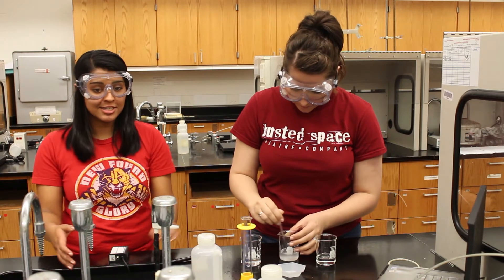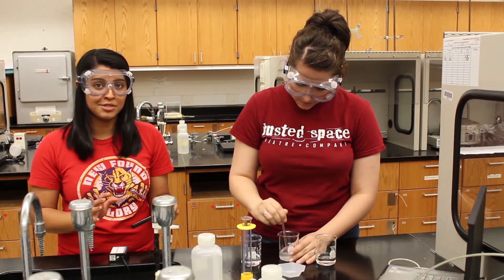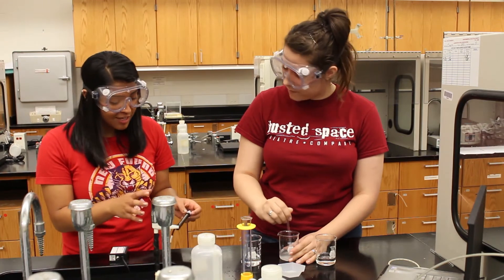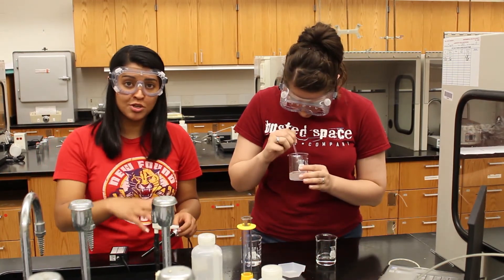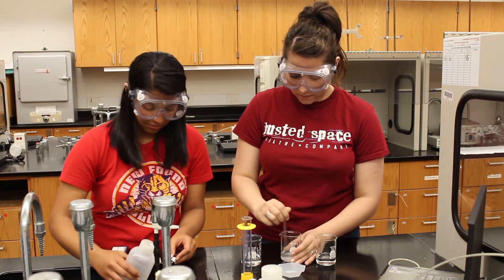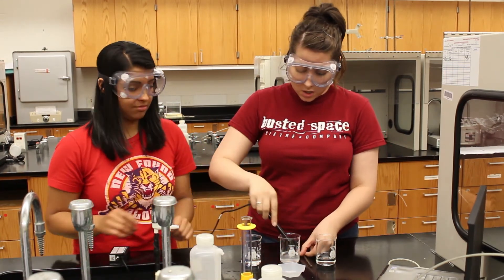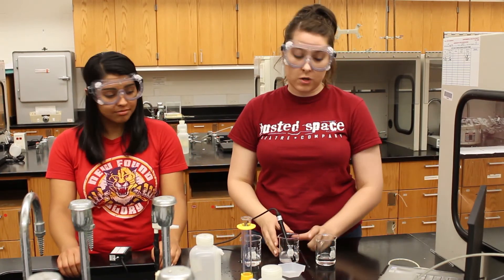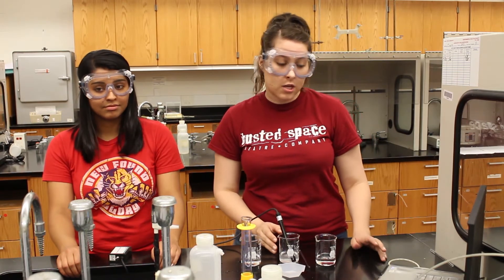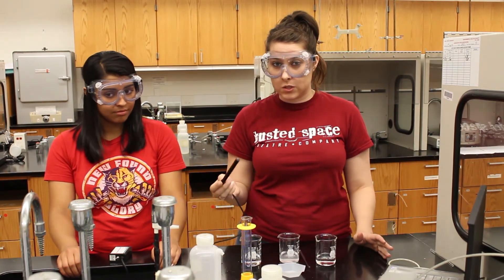We first need to test the conductivity probe to make sure that it reads to about 38 microsiemens per centimeter. If it doesn't give this reading, make sure to wash with dishwashing soap and distilled water. You want to let your conductivity probe set for about 30 seconds before you get your reading so that it can stabilize, and make sure that in between each reading, you wash the probe with distilled water.